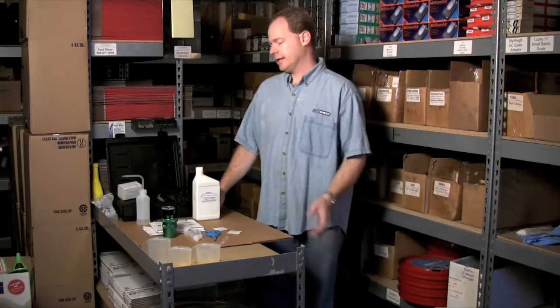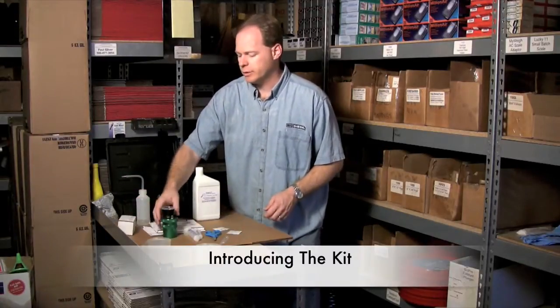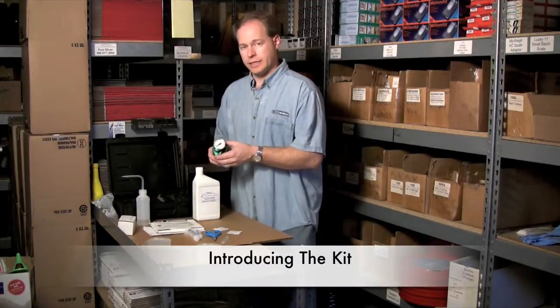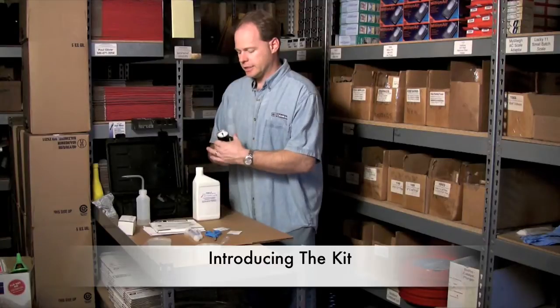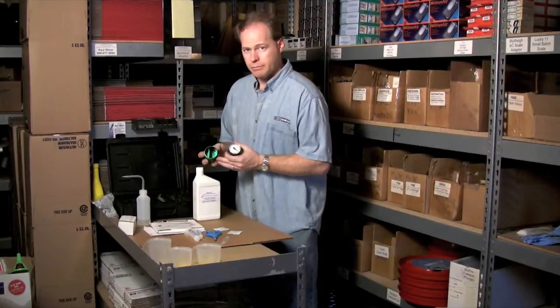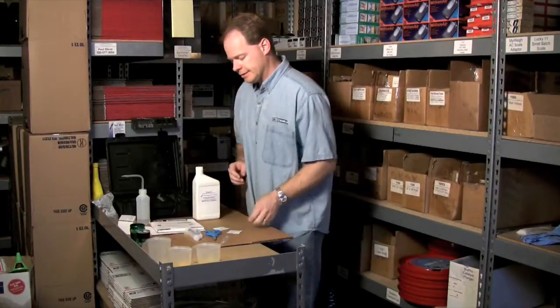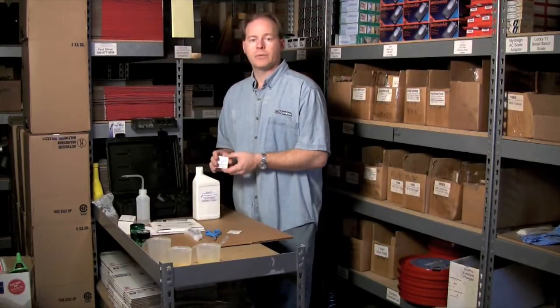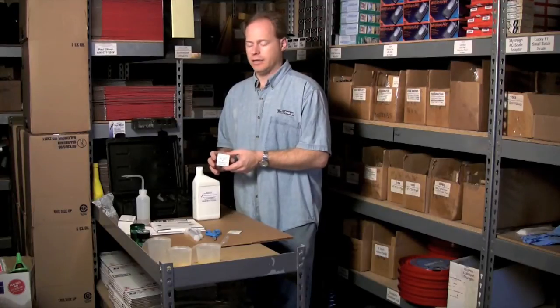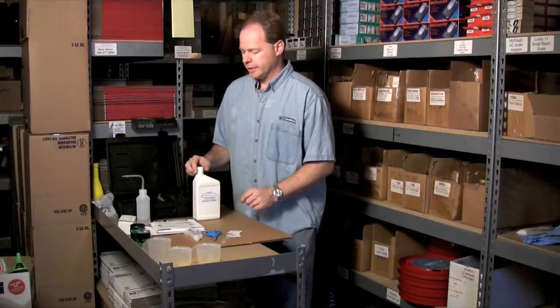I have a tool called a Sandy Bray Water Tester, and I'm going to show it to you and then we'll actually do the test. This kit comes directly from Sandy Bray Laboratories. It comes with the testing vessel, it's got a gauge on top, and then inside is where you'll actually do your sampling. It uses a chemical called calcium hydride to react with hydrogen in water, which produces a gas, which produces pressure, which is how you take your reading.